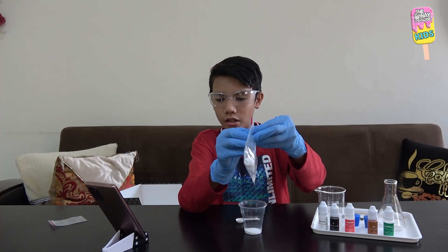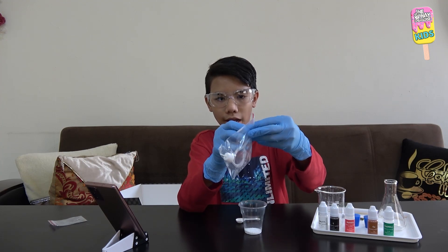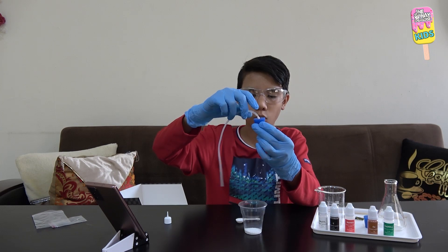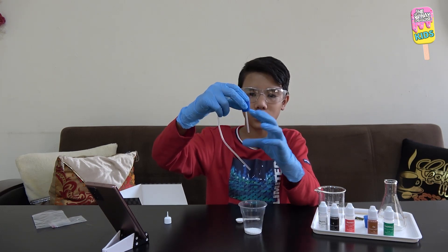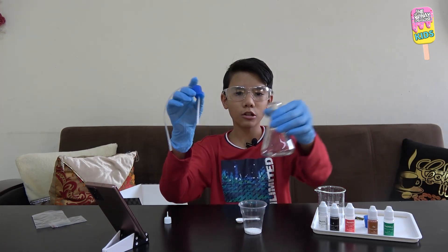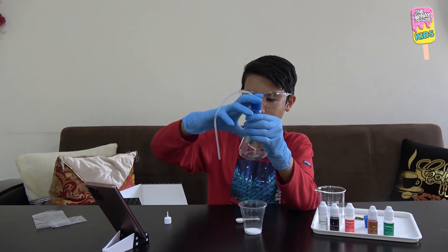Next, I will take the bottle nozzle and tubing from the plastic bag and I will insert the tubing inside of the rubber stopper with one hole, leaving around 10 centimeters. That should be 10 centimeters. And now I will close the dry flask with the stopper.